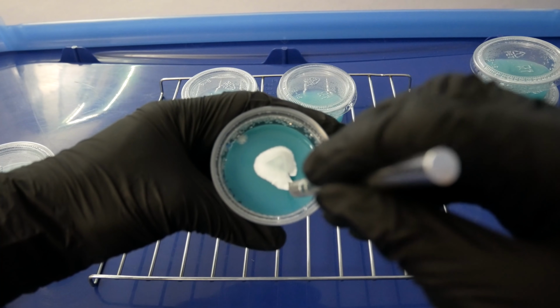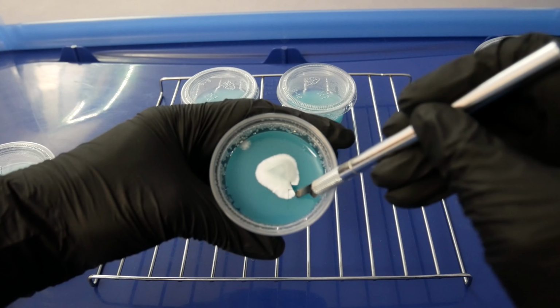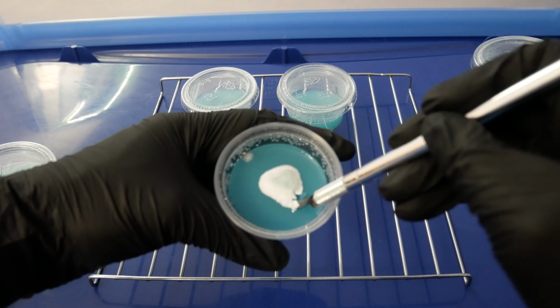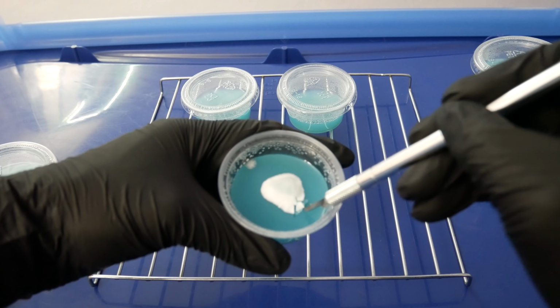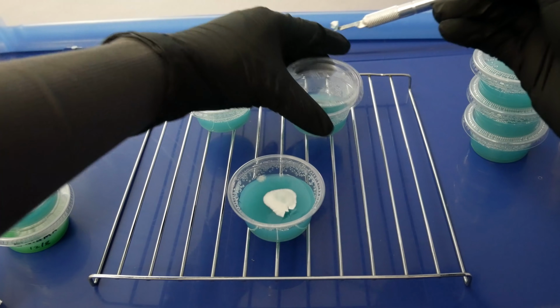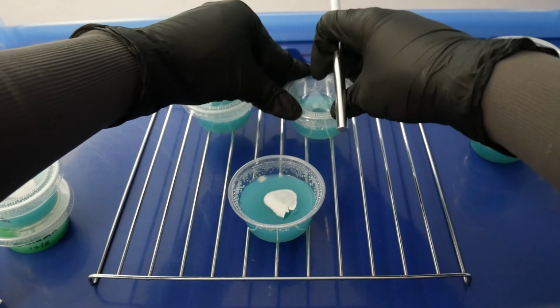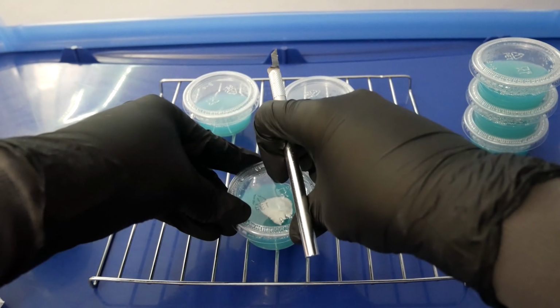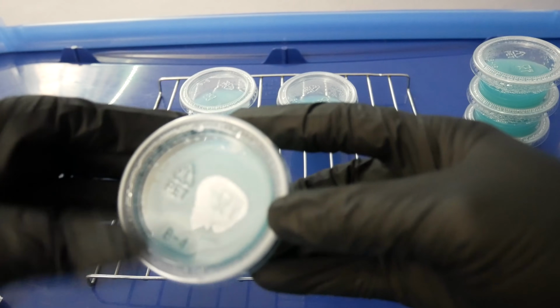I'm going to be selecting parts of the mycelium that's on the outer edge. I'm also selecting them furthest away from the contamination source. I look for mycelium sectors on the outer edge that are stretching out the most compared to the rest. This is usually a sign of fast colonizing genetics that are healthy. Typically, I'll flame sterilize as needed. After 1 or 2 transfers, I'll go ahead and flame sterilize the blade again before making a new selection. If you want to be extra safe, you can flame sterilize before every transfer. Nobody's stopping you, and everyone has their own ways of doing things. I just find that this works best for me, as I'm not wasting butane in my torch all the time.